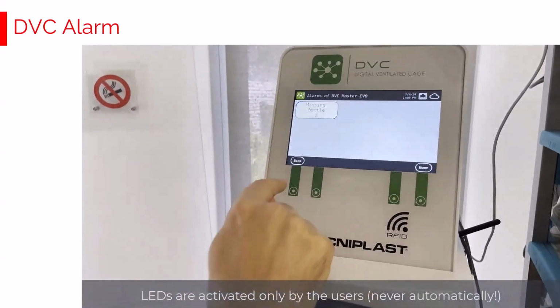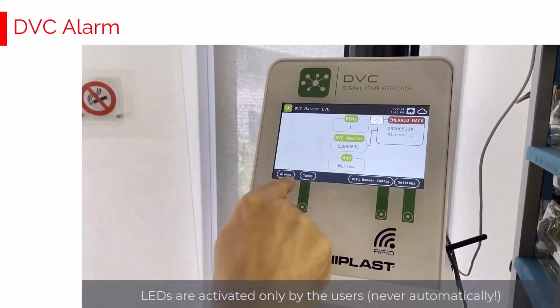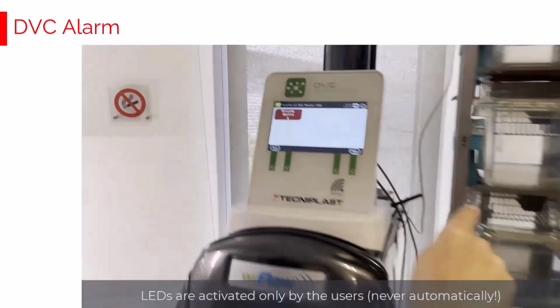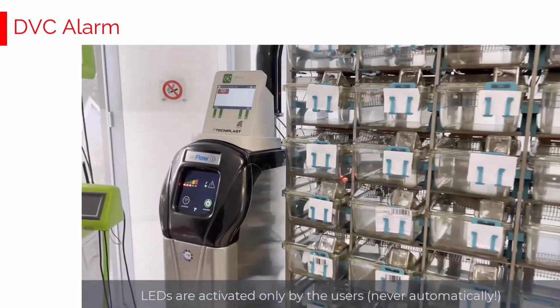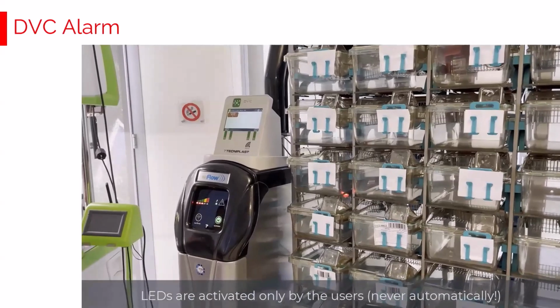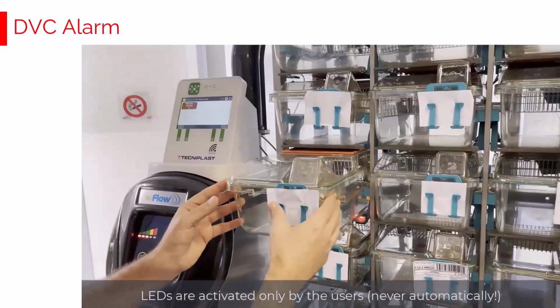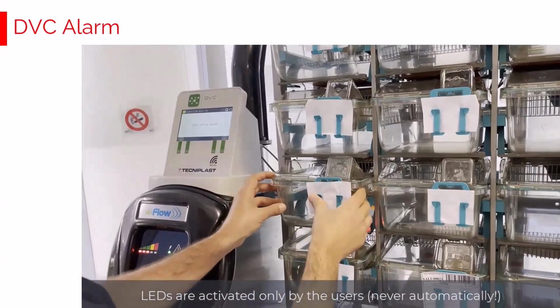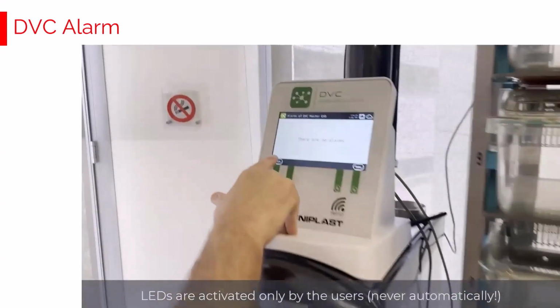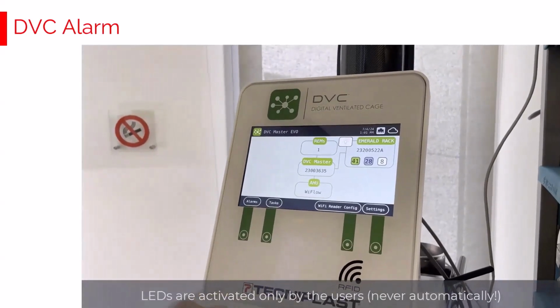The same can be directly accessed by clicking the alarm button in the home page of the master interface, and this recaps the overall alarms attached to the entire racks attached to the DVC master. In this case, there is only one, so it is obviously the same alarm shown before. Checking the status of the cage, inserting the water bottle. Now the alarm has been cleared and there are no active alarms currently in this DVC rack.